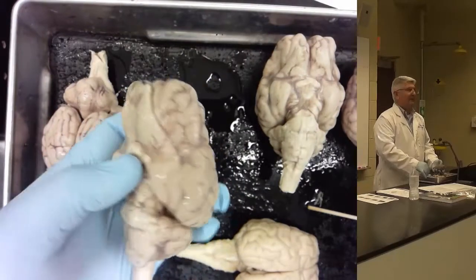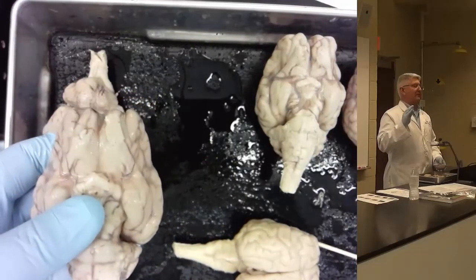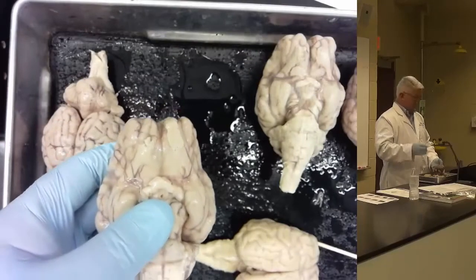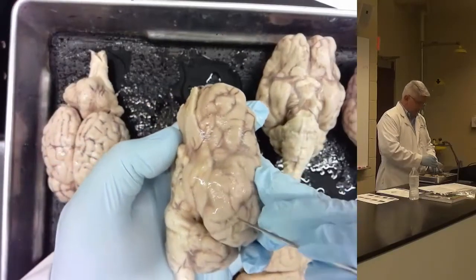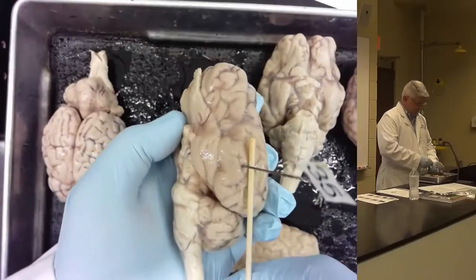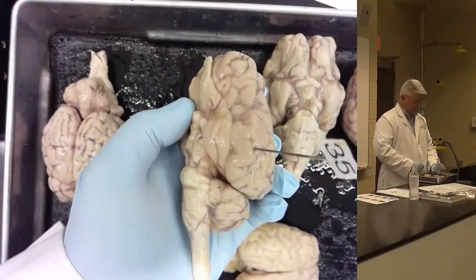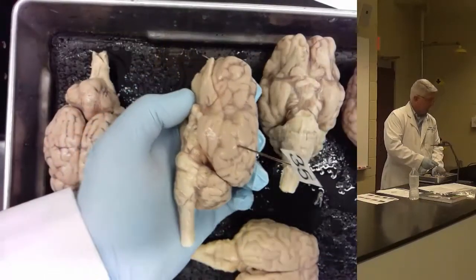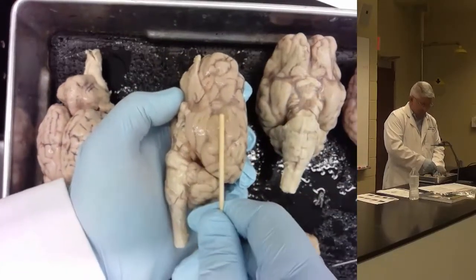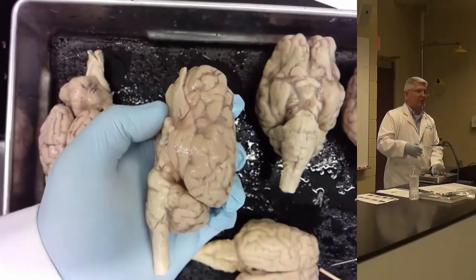Now, I told you that there's no structure to be marked from the top and the bottom, and that's a lie. There's one that can be, and that is the lateral fissure. The lateral fissure is the lateral most fissure, and it really separates the parietal lobe and the temporal lobe. The temporal lobe is very, very small. You all see that? The temporal lobe, here in this sheep brain, it's just one little gyrus. Right? That's one difference between human and sheep brain.